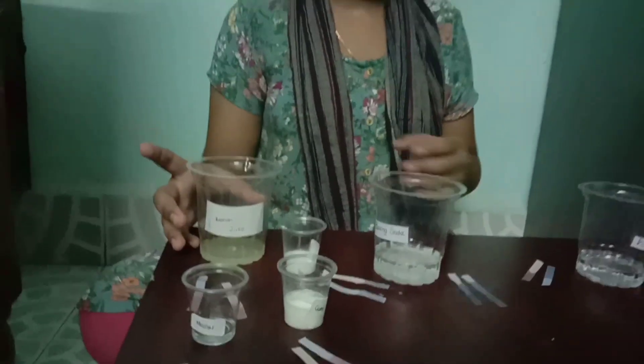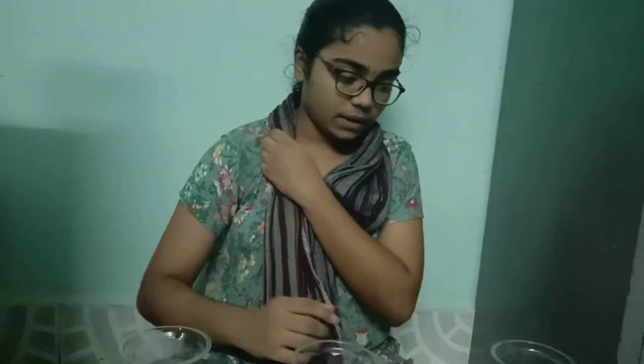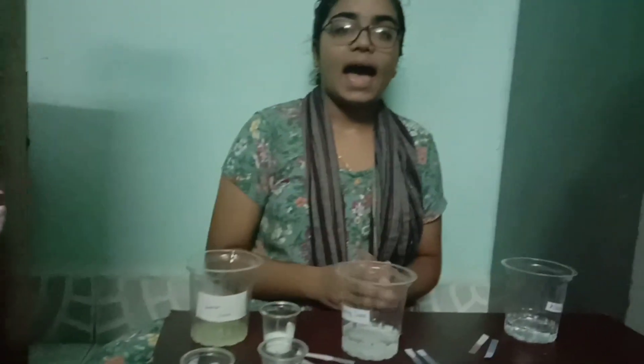These are the different experiments. From this, what we can conclude is: acids turn blue to red in litmus paper, and bases turn red to blue in litmus paper.